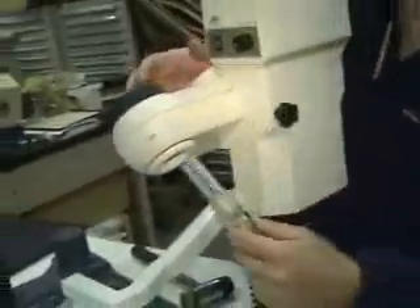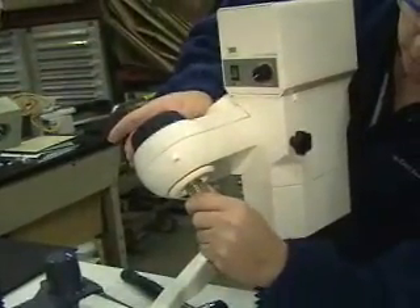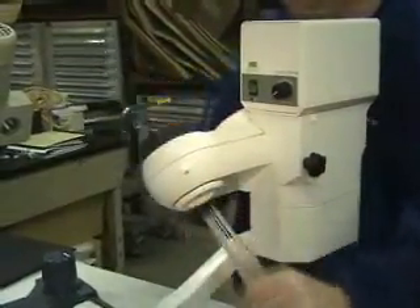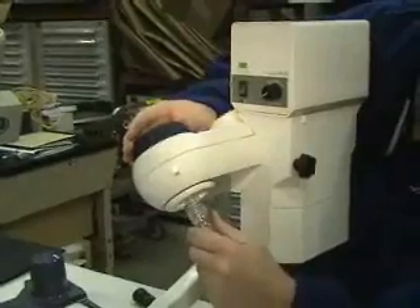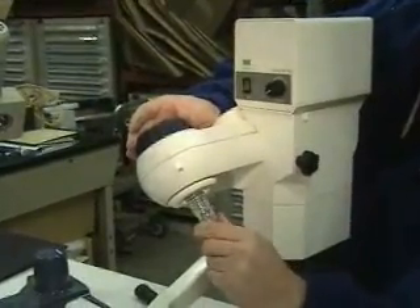On the R-114, same piece of glassware — listen closely — it will click in. The older piece of glassware clicks, but there's a lot of play in it and it'll just fall right out.